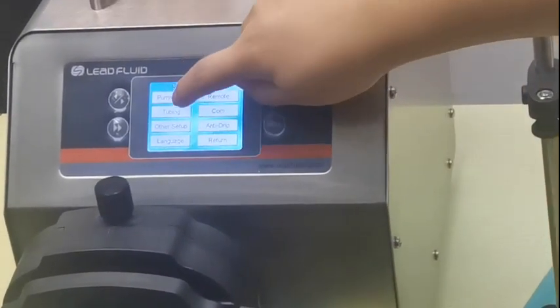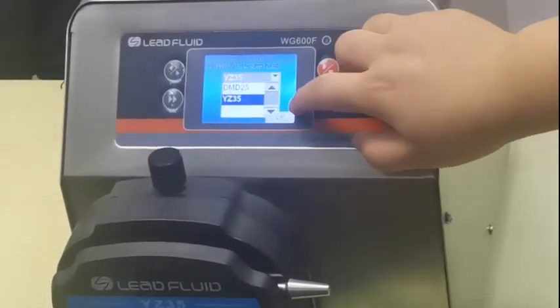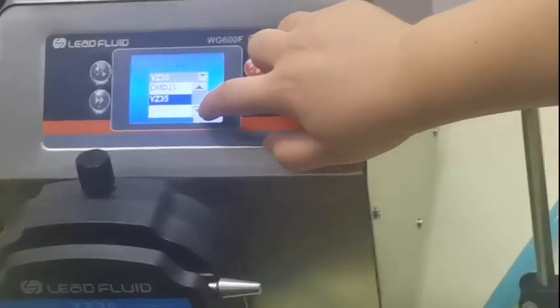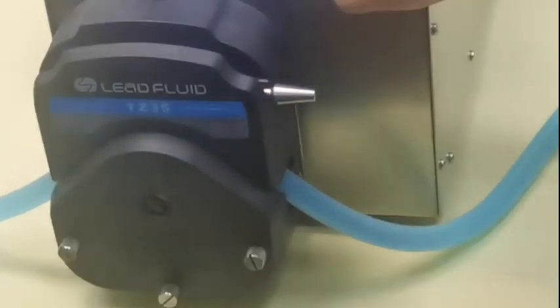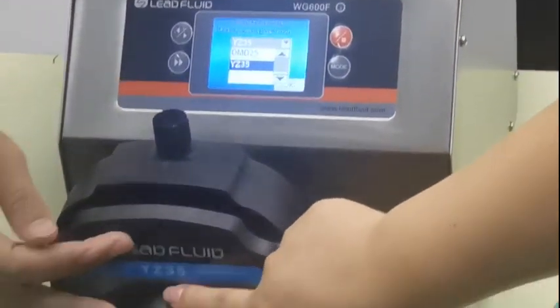First, choose the pump head. For example, model 35 — you can see the model number on the pump head here.